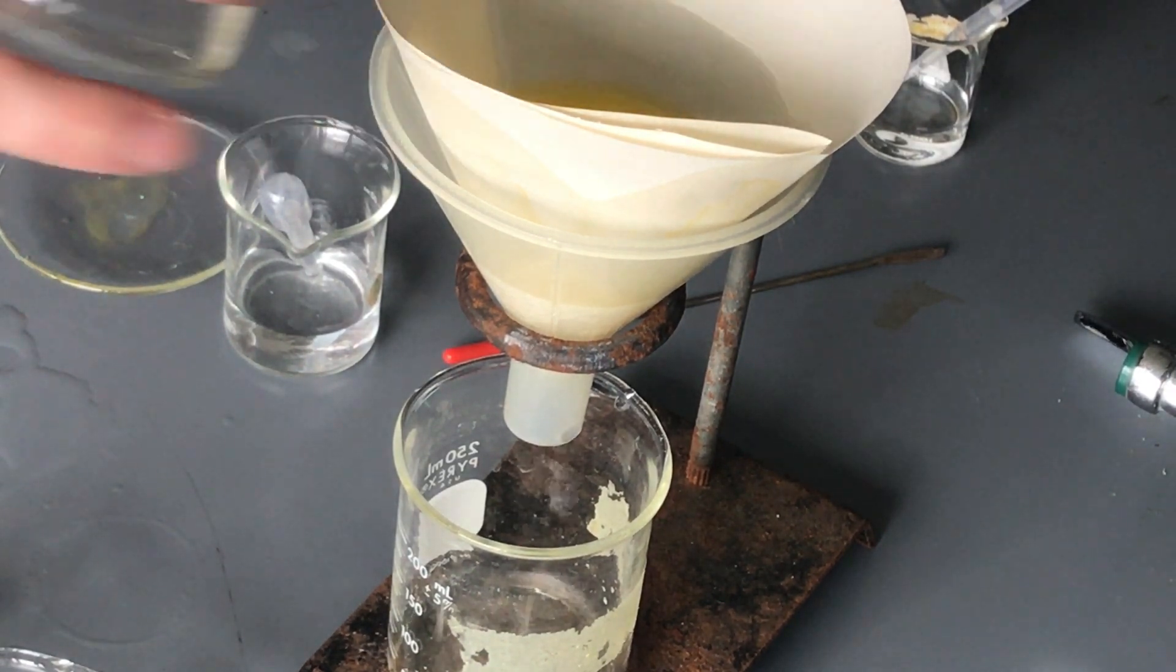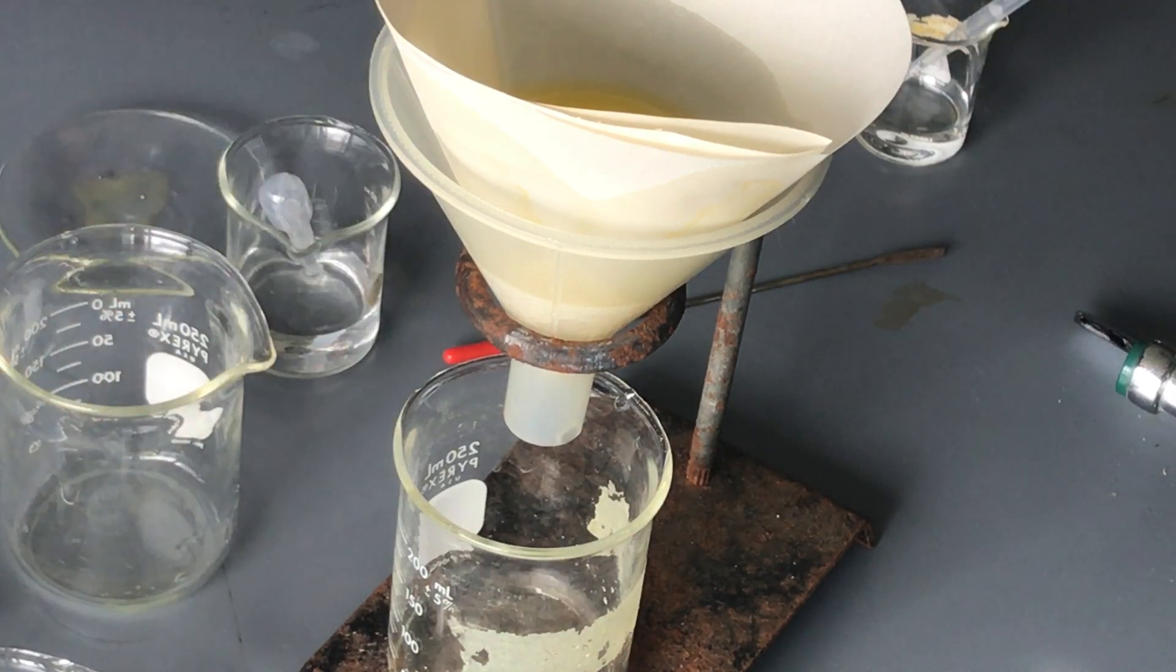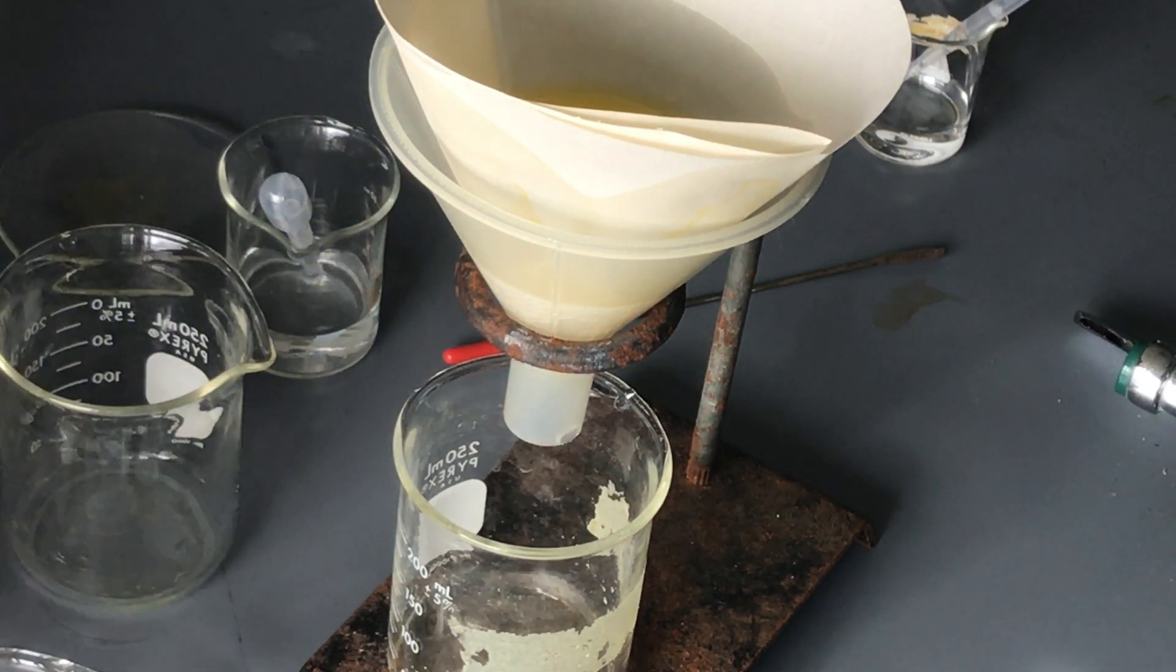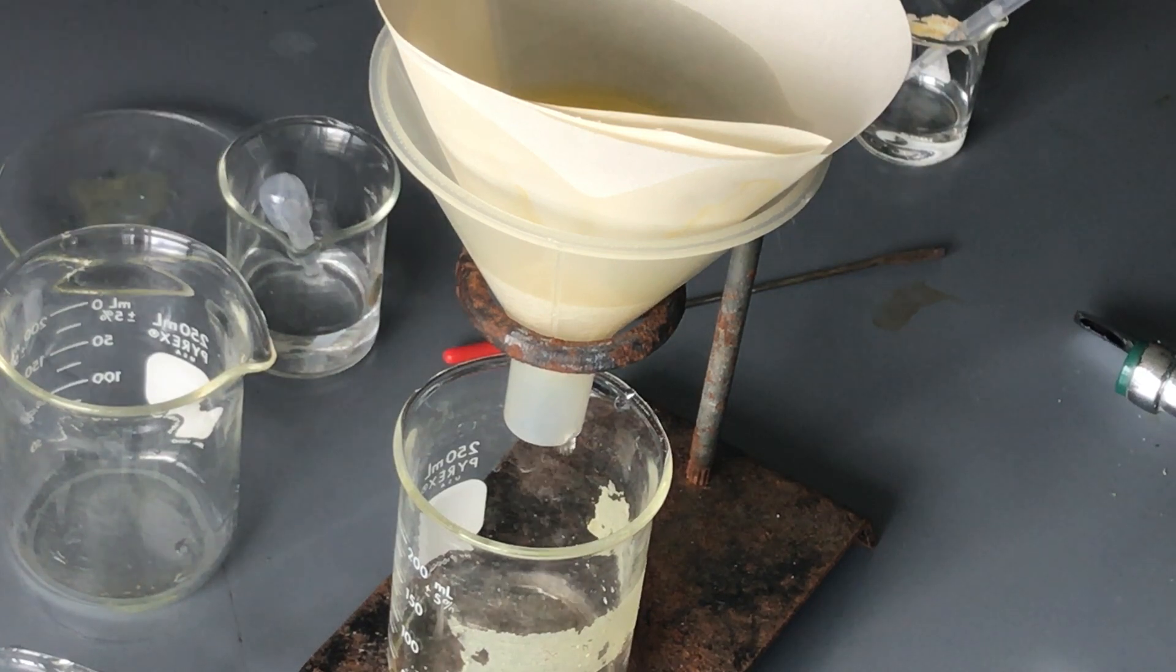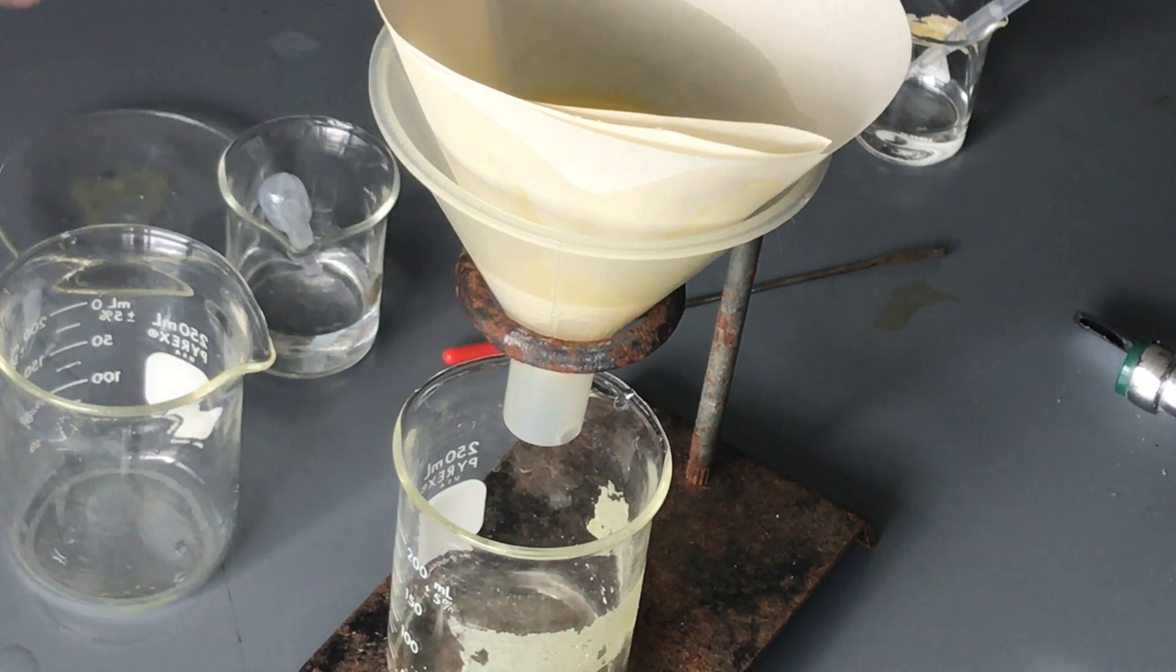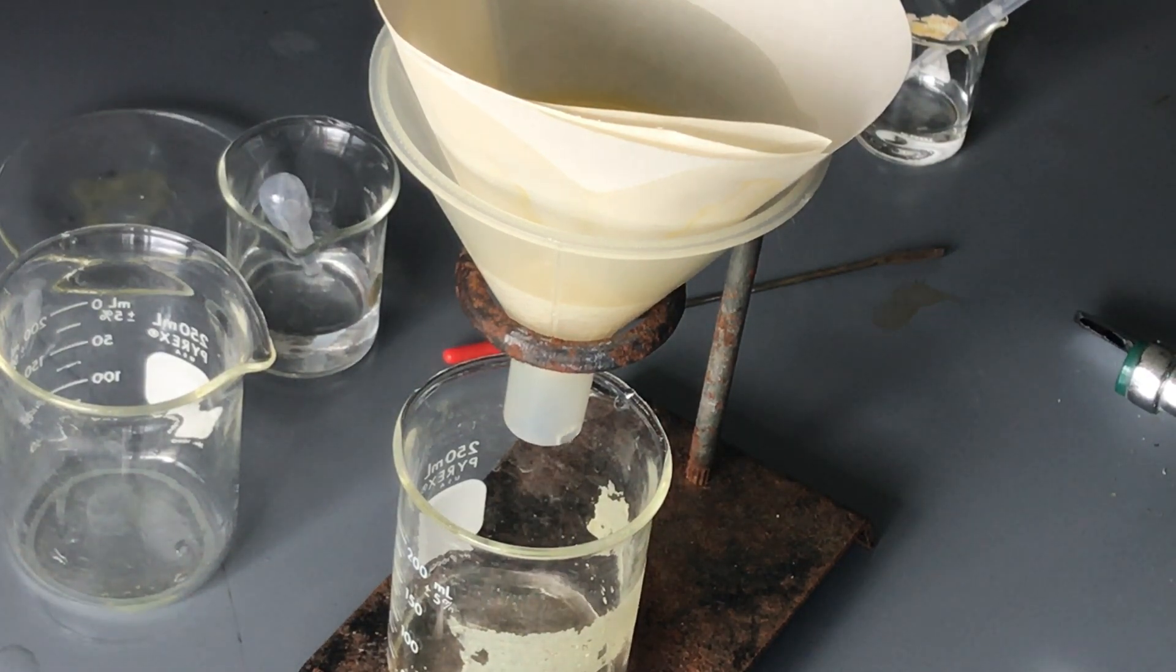I'll actually wipe out with the paper, so for example if we take this little paper towel here and I'll show you a perfect example. If I take this and actually wipe through, we'll actually see that there is a little yellow on that paper towel. And I apologize for the noise in the background if you're hearing that, they're doing a little construction at the school that I work at.